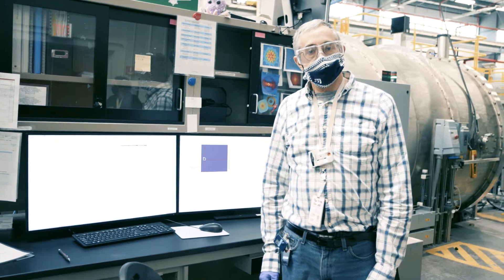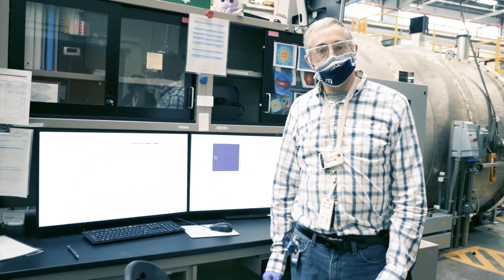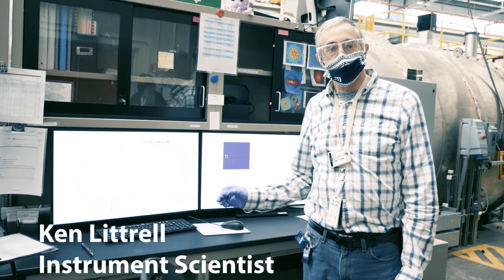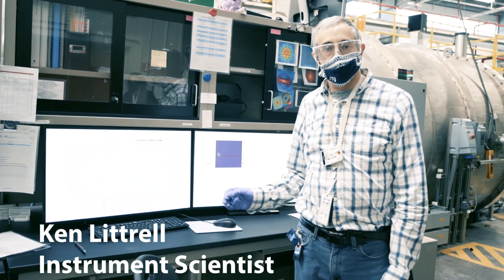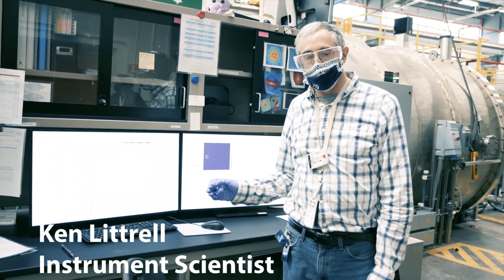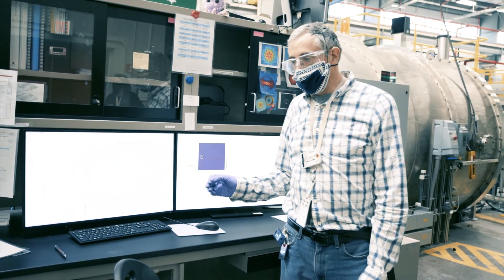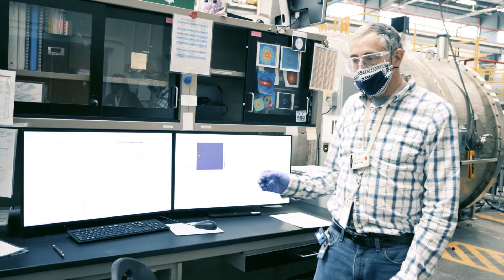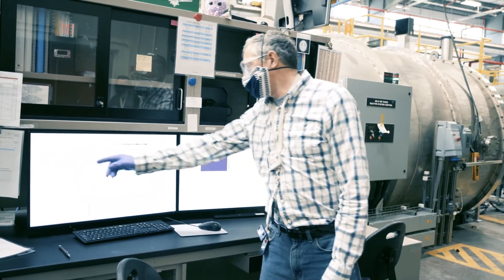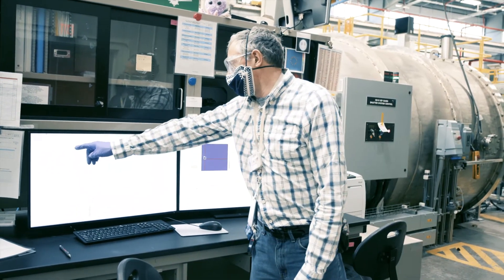The purpose of this experiment is to see how the precipitates in these steels evolve as a function of time at a given temperature. So what we're doing here is we are going to set the furnace to a particular temperature.